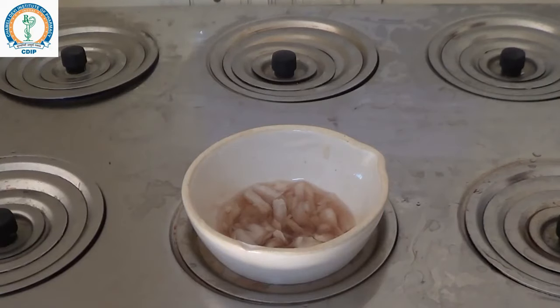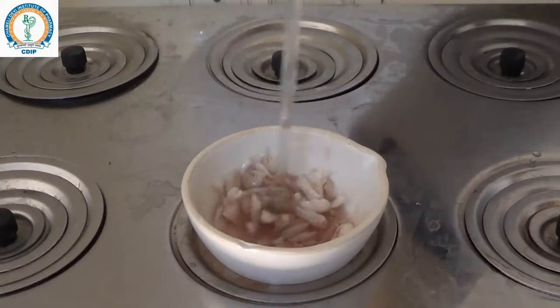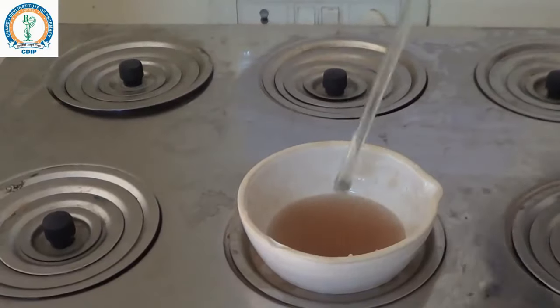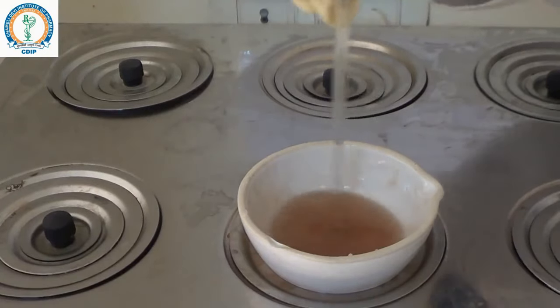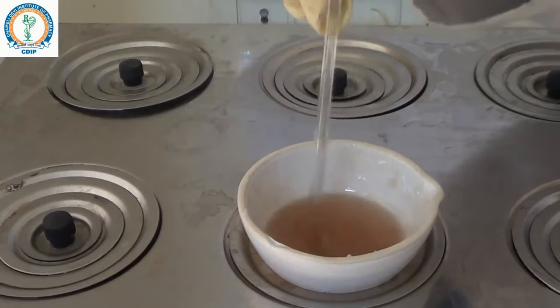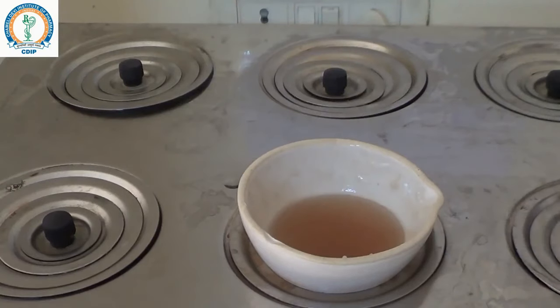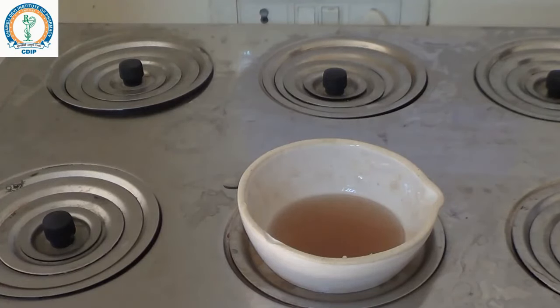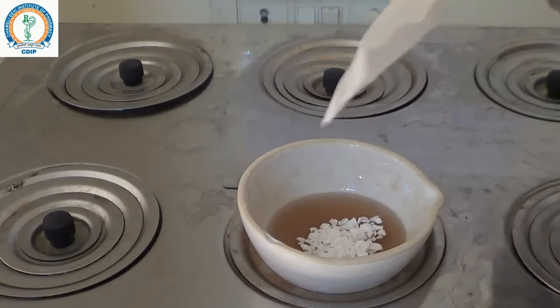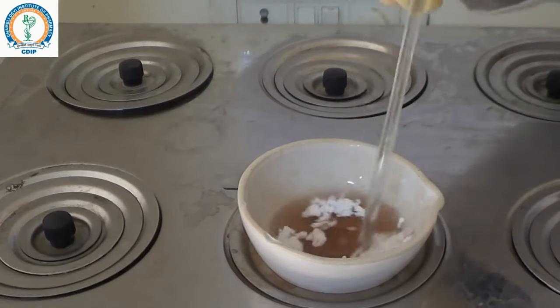Melt the beeswax with continuous stirring using a glass rod. Now you can see the beeswax has melted. Next, 1 gram of cetyl alcohol is added with continuous stirring using the glass rod.